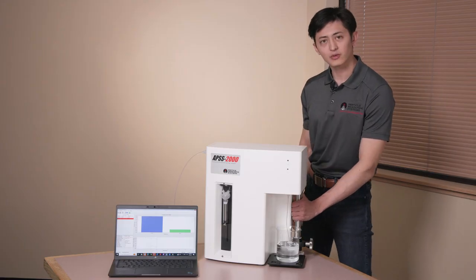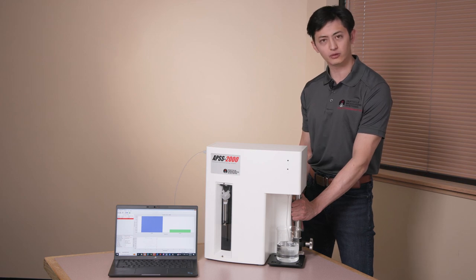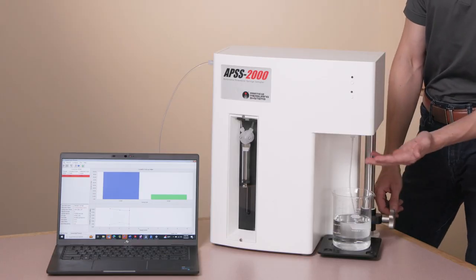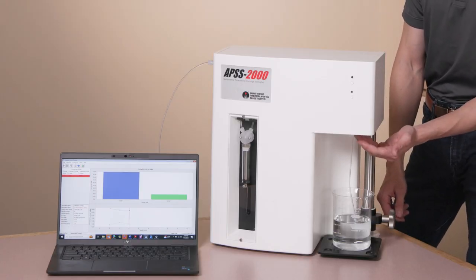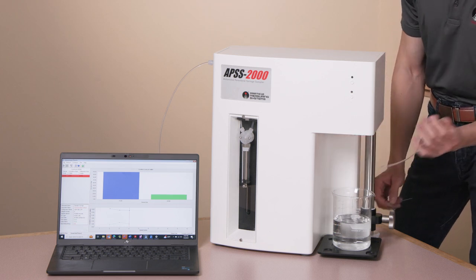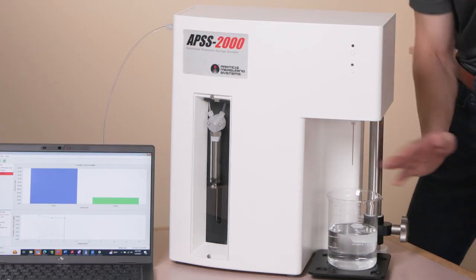We also have an IV bag holder that can be mounted to the vertical member of the unit. This is used when someone is sampling a large volume injectable. Above the stage is the inlet of the sampler. This is a standard Luer Lock, which is used to easily change the inlet tubing based on the needs of the user.